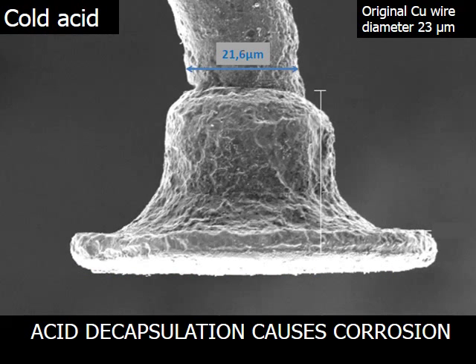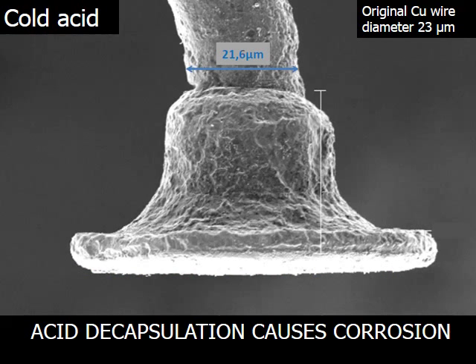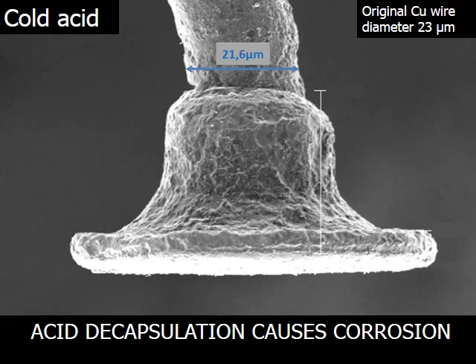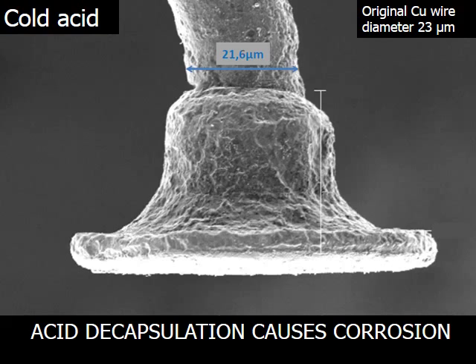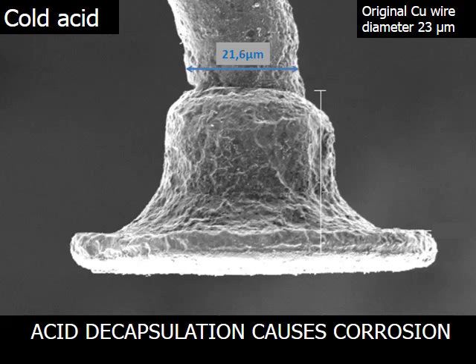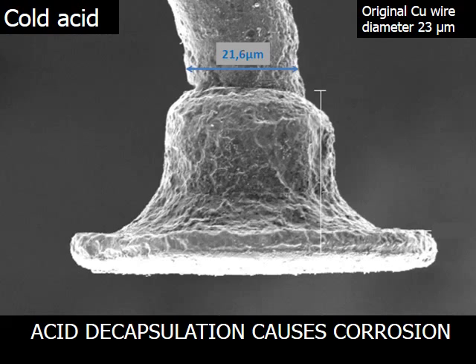Here we see a SEM photo of what was originally a 23 µm diameter copper bond wire. Acid decapsulation has reduced the diameter of the copper bond wire by 1.4 µm, with severe corrosion visible, making further analysis of the copper bond wires impossible.